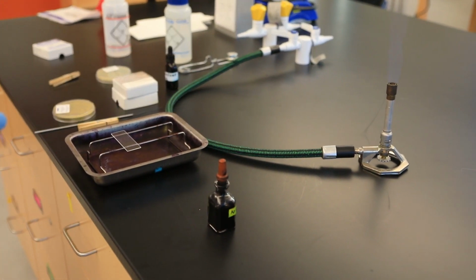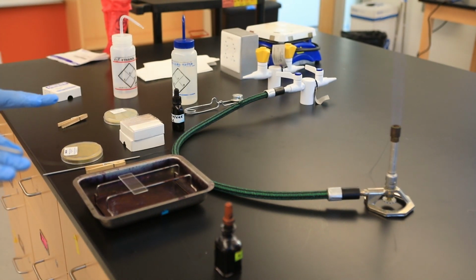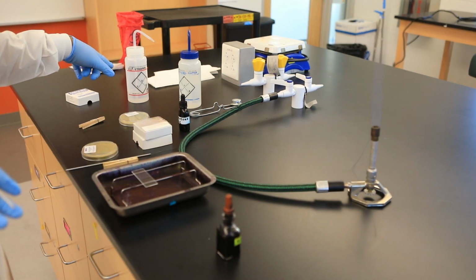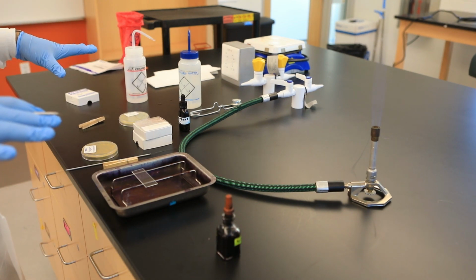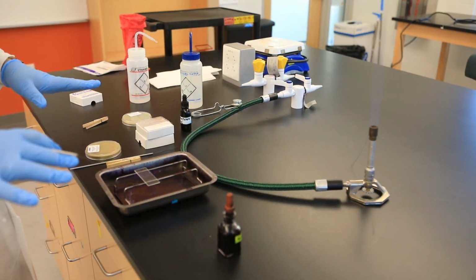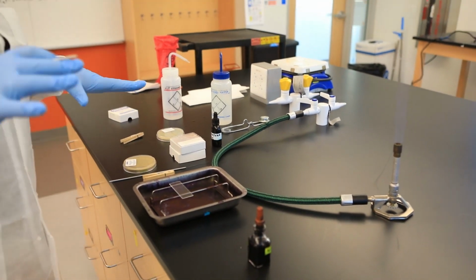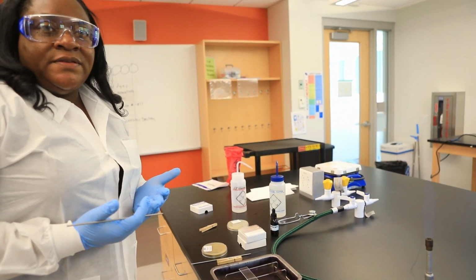Before you even start any type of work with microorganisms, or just research in general, you should always disinfect your work area. My disinfection of choice is 70% ethanol, and I explained why we use 70% compared to 100% or a higher percentage. We disinfect our work area before and after conducting a technique or any type of experimentation. And we also make sure we have the proper personal protective equipment. So I have my lab gown on, my goggles, which I also disinfected with 70% ethanol, and my gloves, okay?